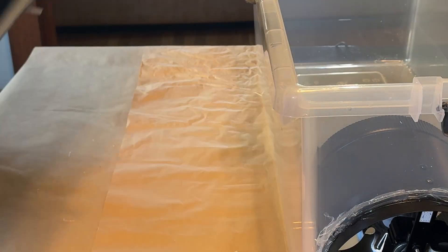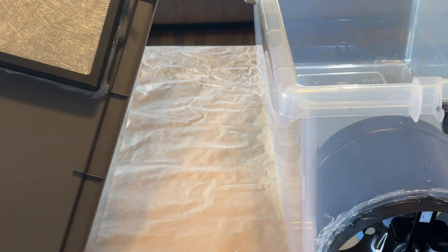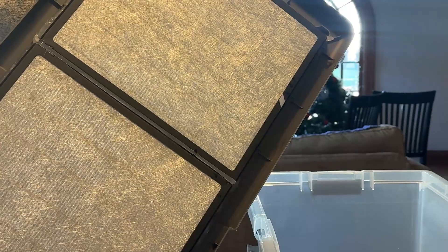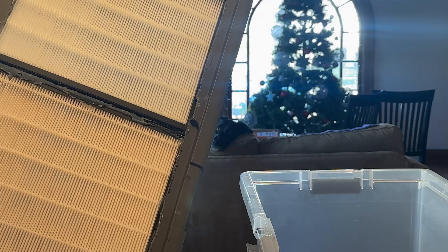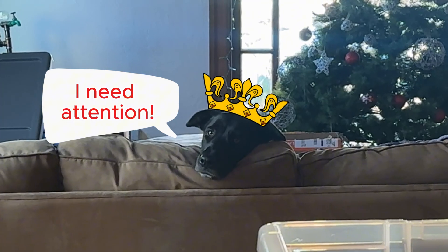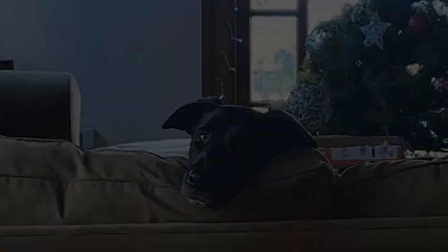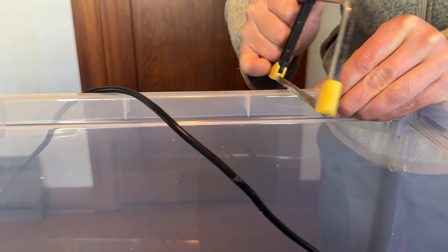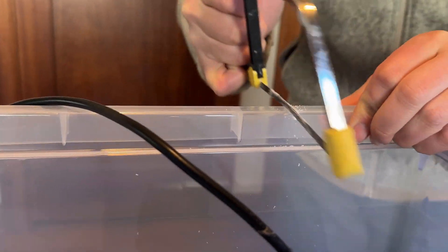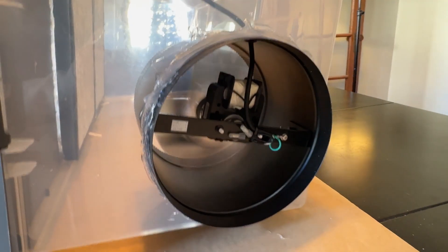After the silicone has completely dried we're almost ready to put everything together. Please don't be alarmed by the hard-looking dog in the background — she has been fed and got plenty of cuddles and treats today, but she can be a bit of a drama queen. Next we're going to cut a little notch into the storage bin for the power cord. After we've put everything together and sealed it up with more silicone, we can finally turn on our new flow hood.